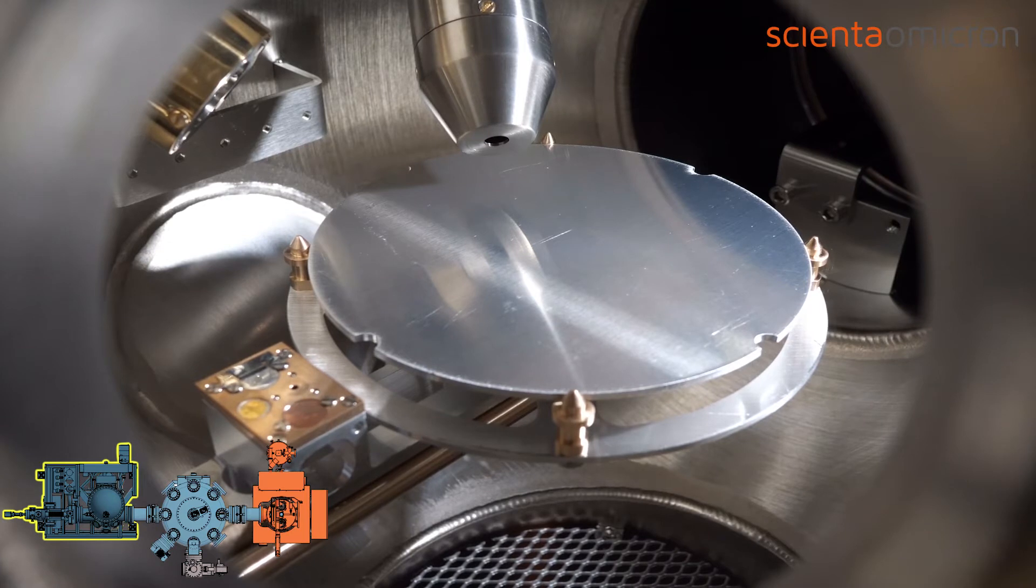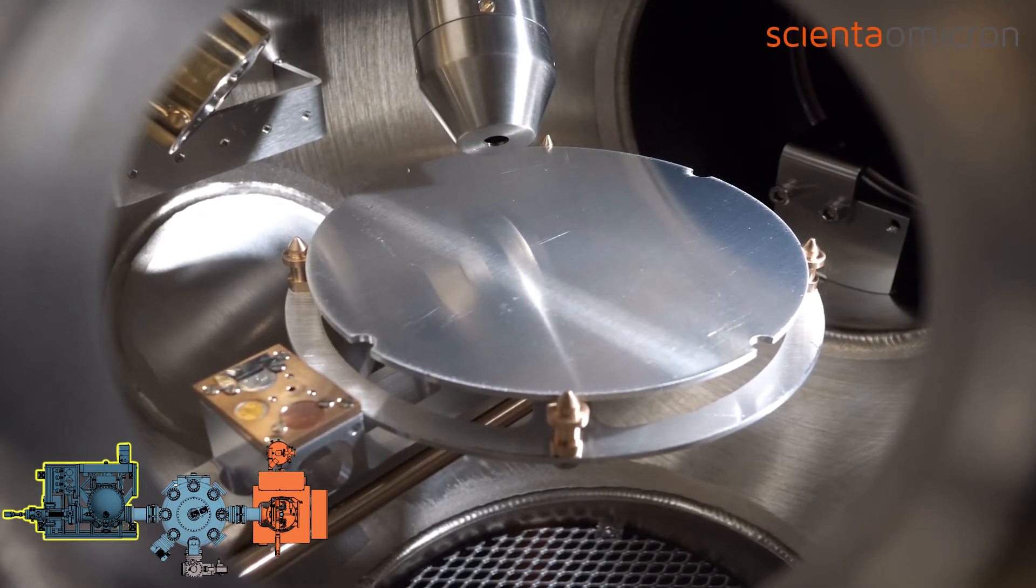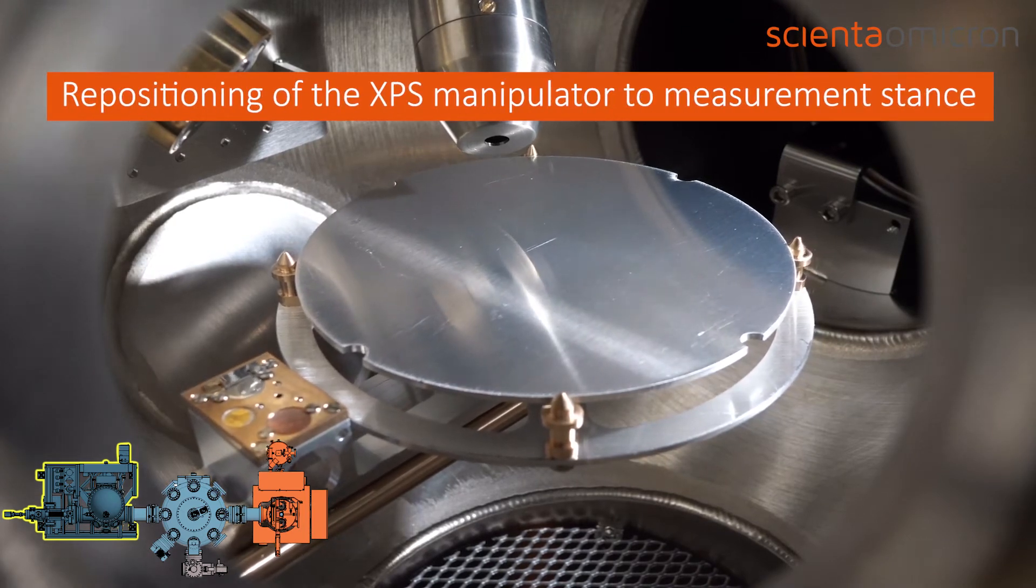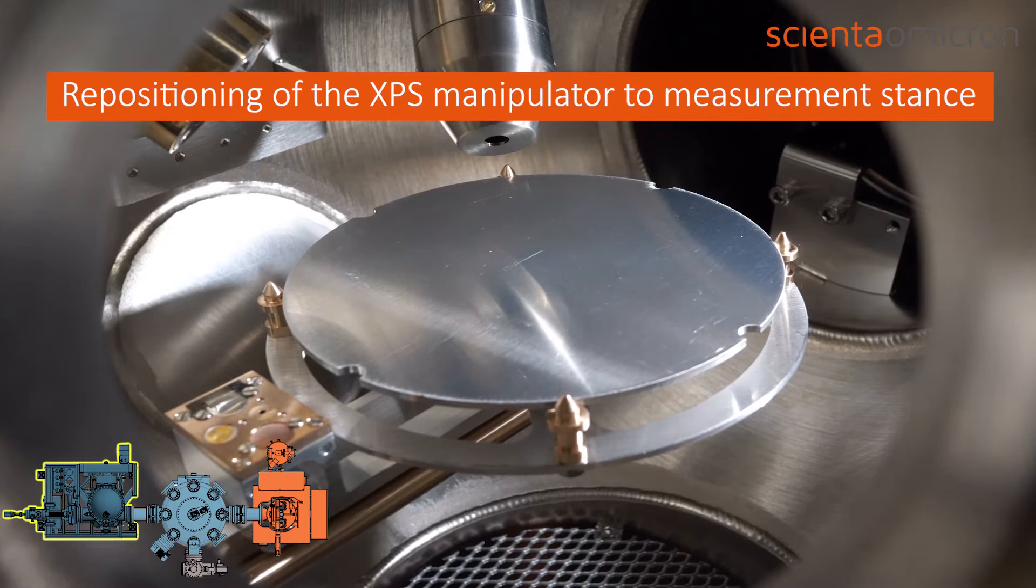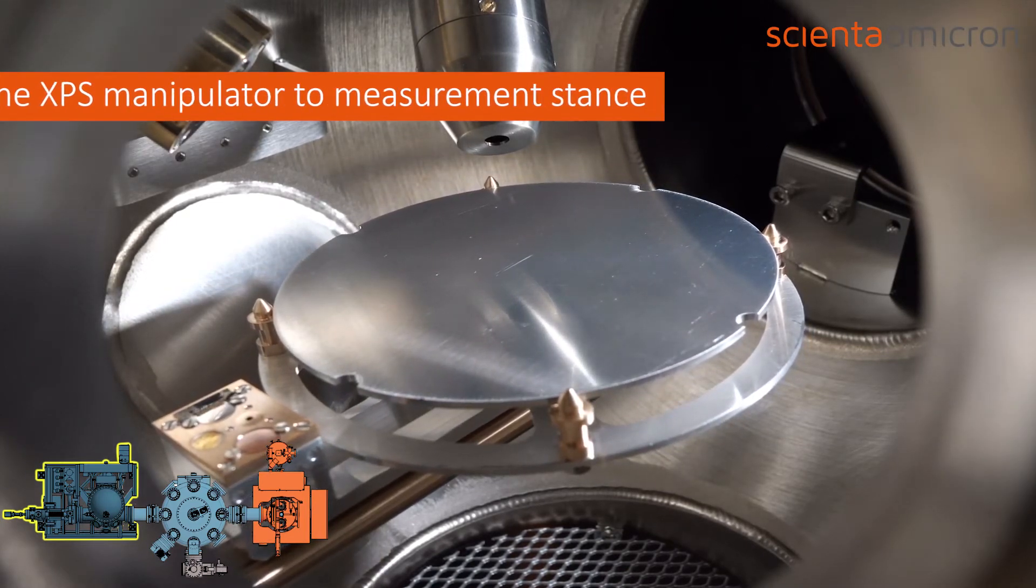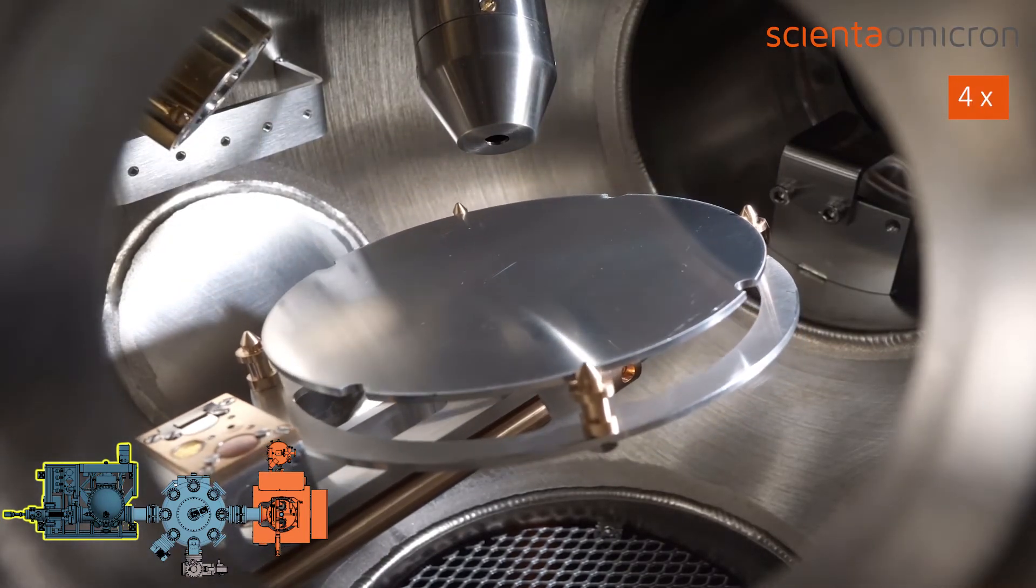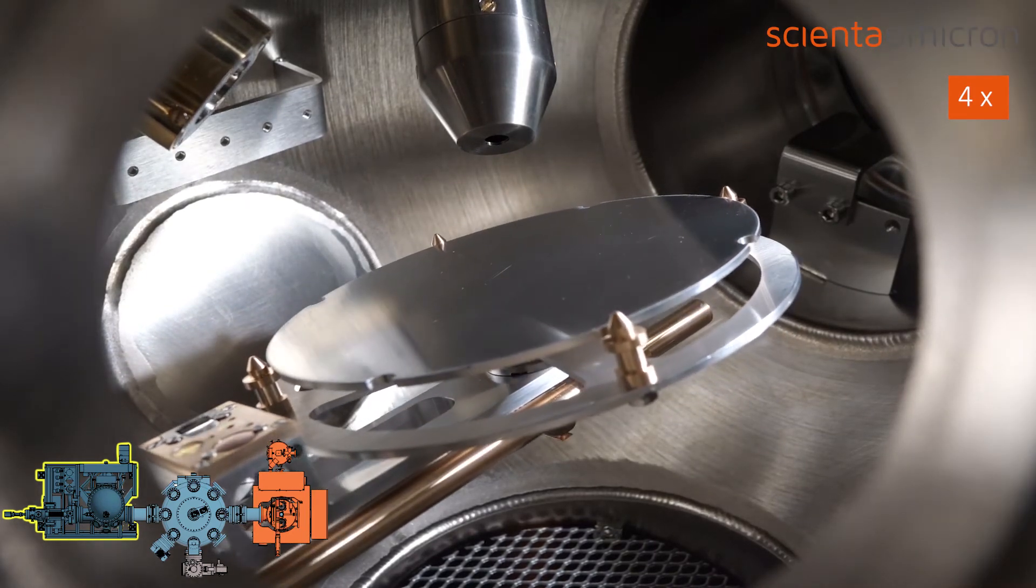In this video, we have chosen an illustrative position to demonstrate the motion of all five motorized axes. Once the measurement position is reached, the XPS analysis can be initiated.